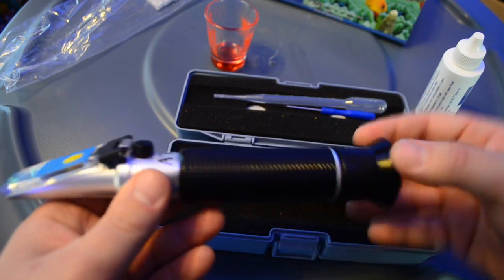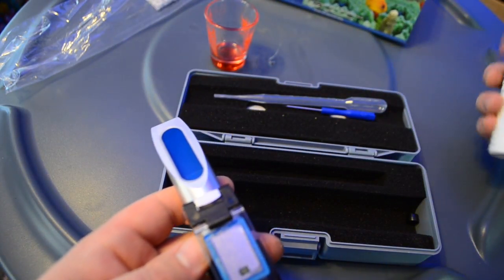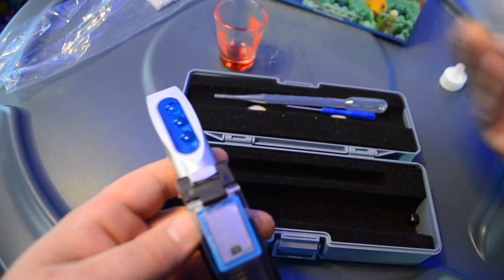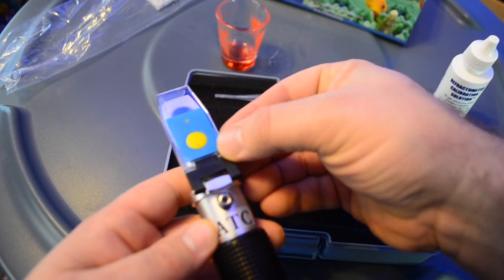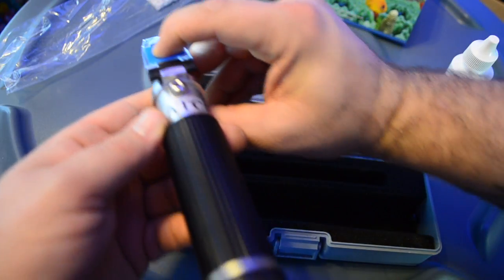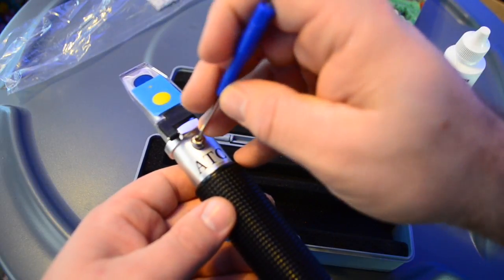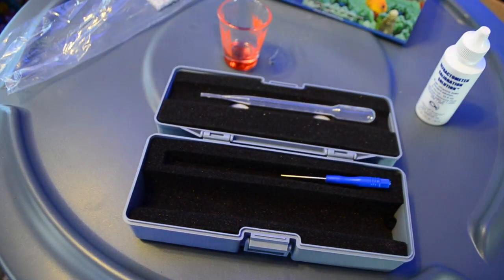It's pretty easy to do. You take the little plastic guide off, open up your prism — the plastic cover that protects it — and then do a couple of drops of your calibration fluid. Drop that plastic piece on there, push on your LED, and look into the eyepiece. It is a little bit off, so we're going to make some small adjustments and then put it back up to the eye and see if it's on.